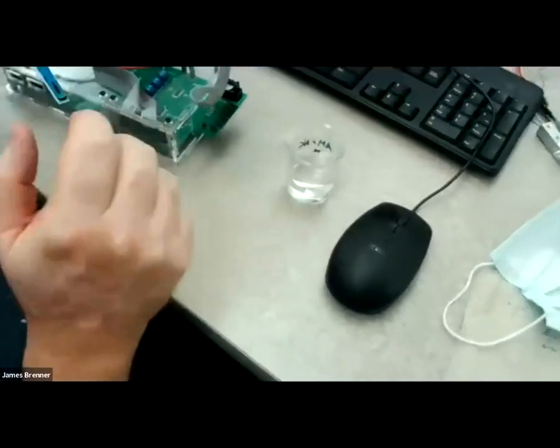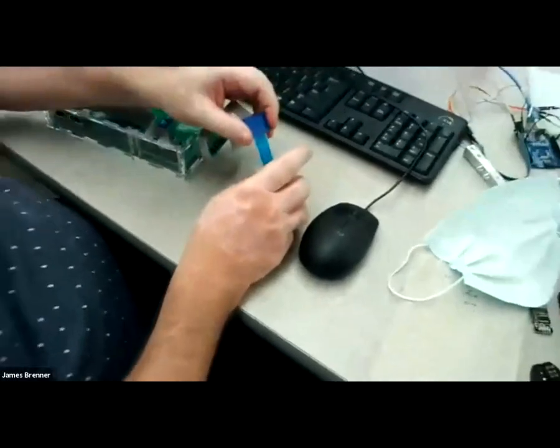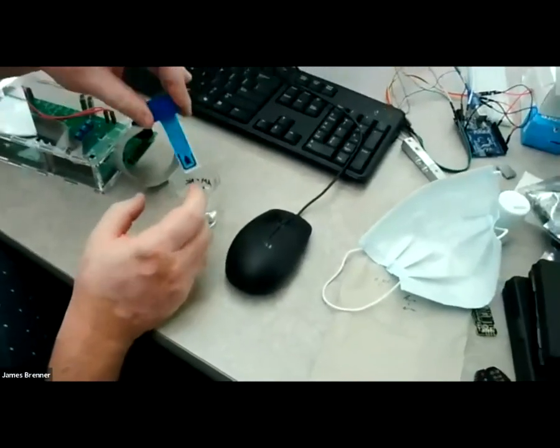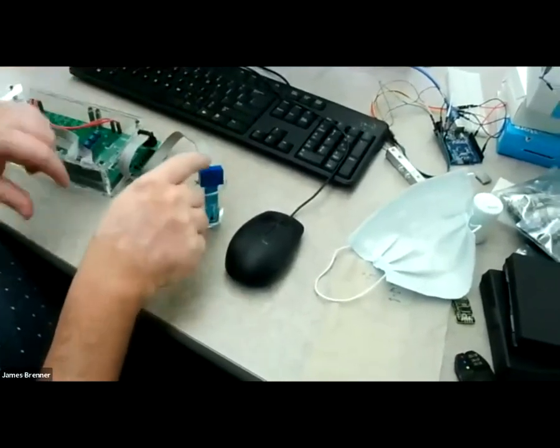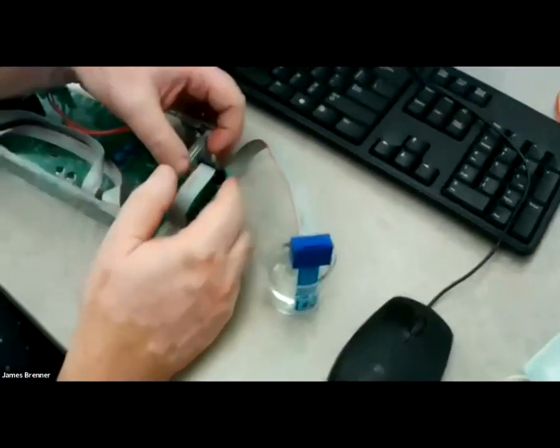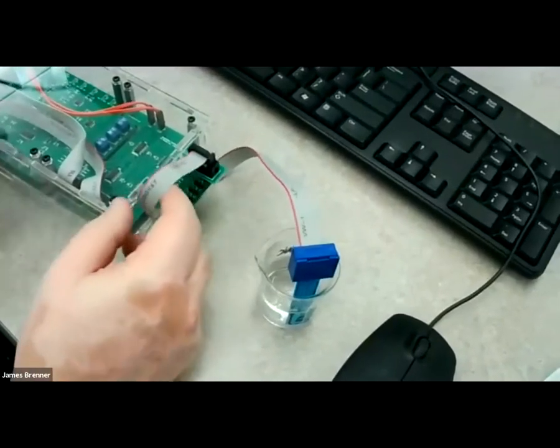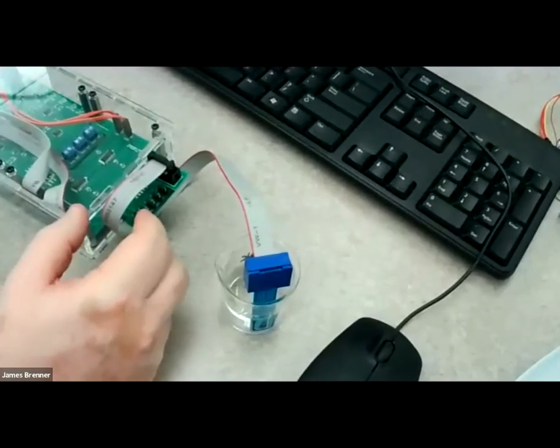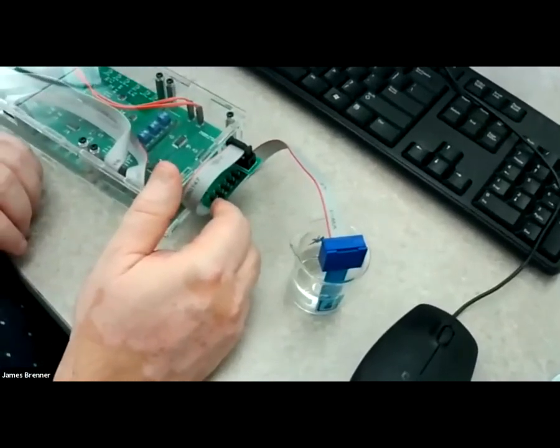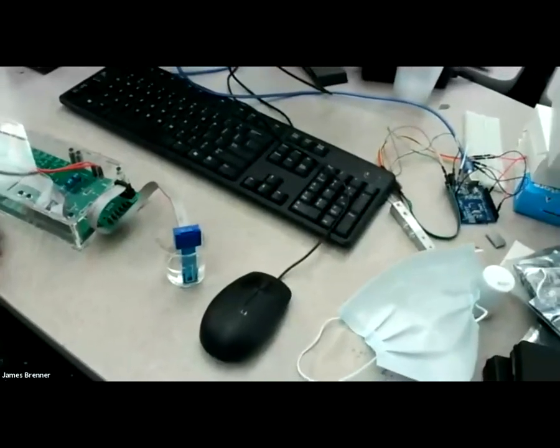In order to get this to work, you'll either need a second sensor on both sides, or you will need a piece of cardboard. Otherwise, it will fall out of this little connector right here that connects to the ribbon cable. And then the ribbon cable connects through a little plastic piece here onto what I'm pointing at right there. And underneath the cable, there's room for attaching up to 7 electrodes at once for measuring up to 7 concentrations at once. I'm only going to do one for this example.